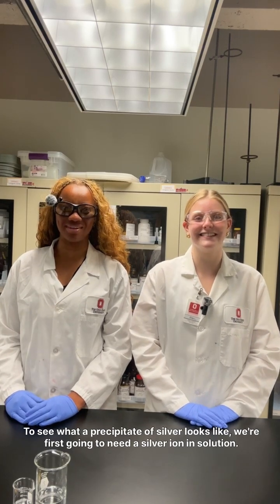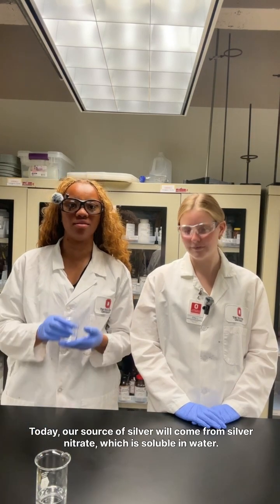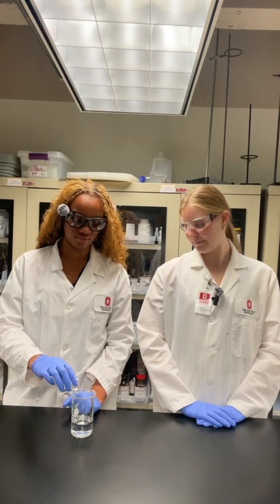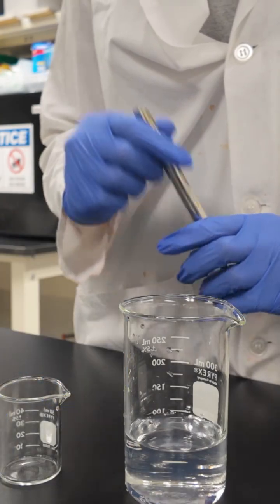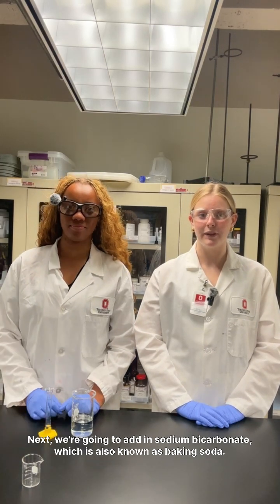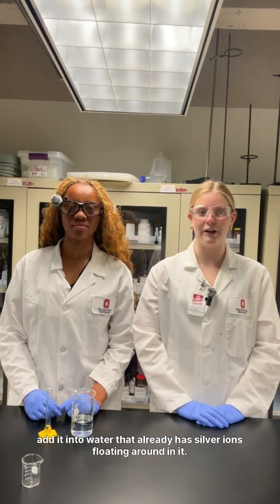To see what a precipitate of silver looks like, we're first going to need a silver ion in solution. Today, our source of silver will come from silver nitrate, which is soluble in water. Go ahead and dissolve it in our beaker of water here. Next, we're going to add in sodium bicarbonate, which is also known as baking soda. Normally, sodium bicarbonate is soluble in water, but we'll see what happens when we add it into water that already has silver ions floating around in it.